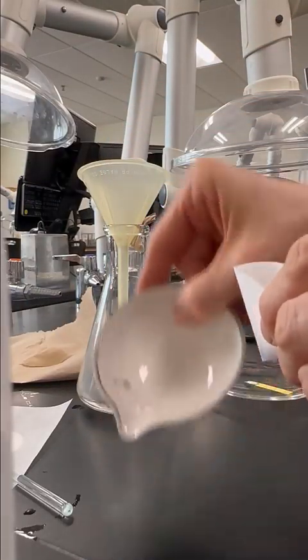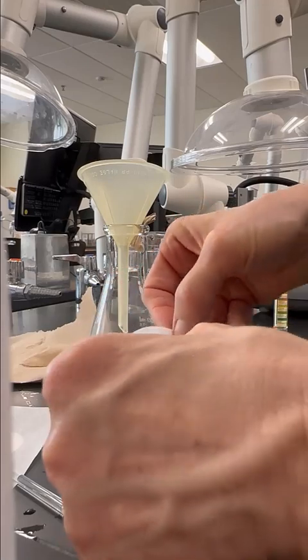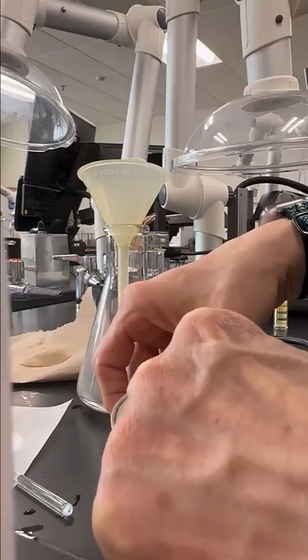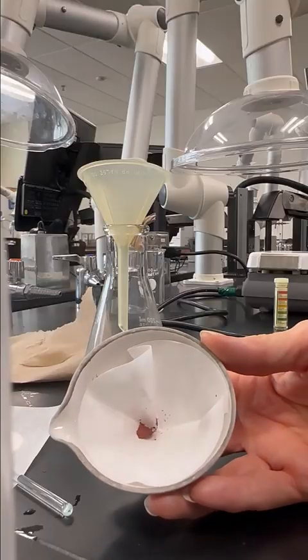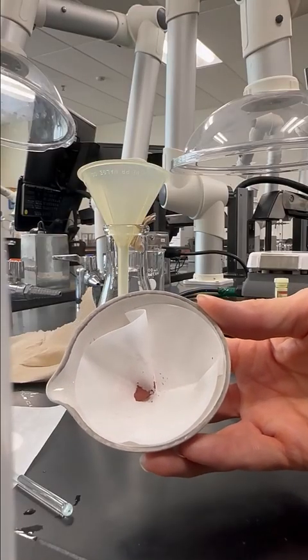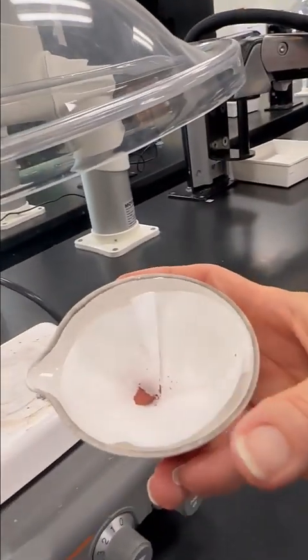It really is clean, it just has some stains in it. I'm going to open up the filter paper now so that it can dry a little faster, and press it into the bottom. So you can see the spongy copper right in the evaporating dish. And I'm going to place this now up onto the hot plate.